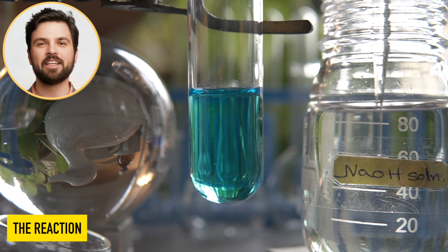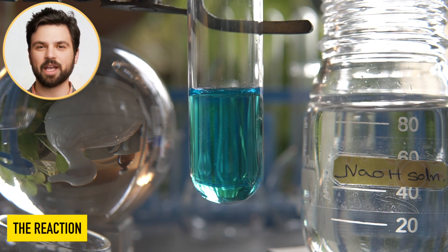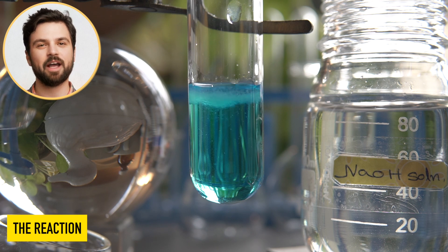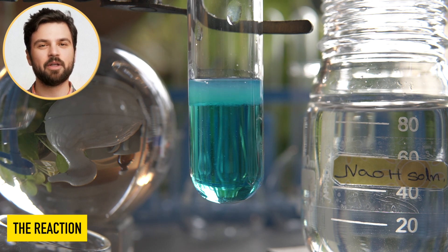Now, we will add clear solution of sodium hydroxide dropwise onto the blue colored copper nitrate solution and observe the effects.